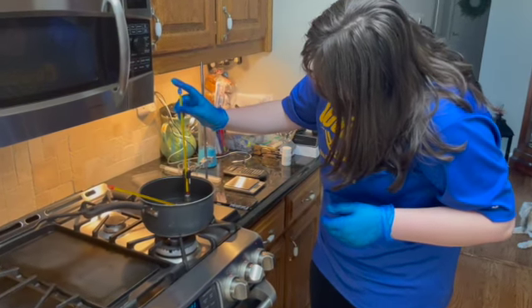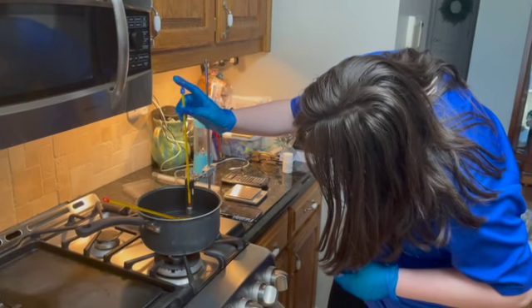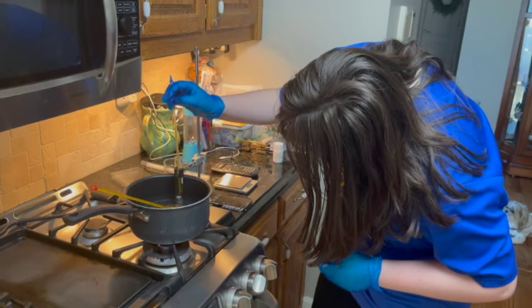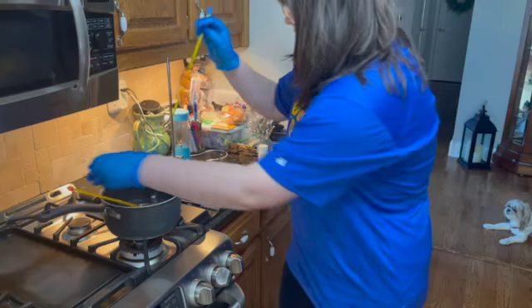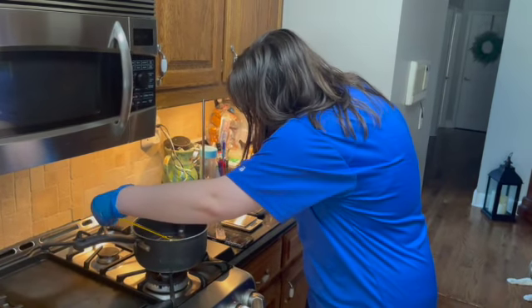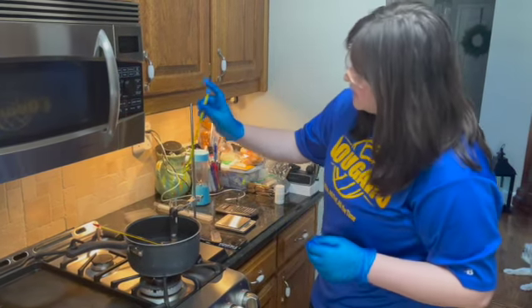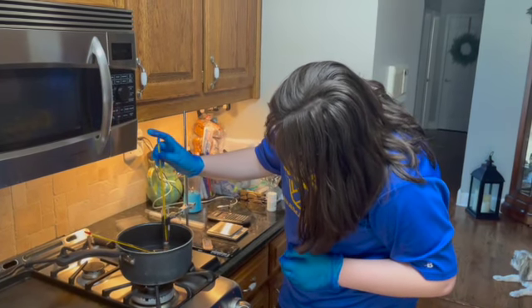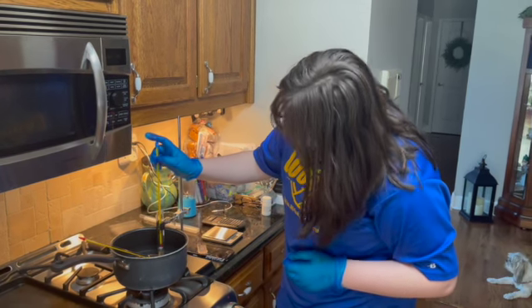We can see, so roughly right now, as we start this off, it's at, let me make sure that I can see it, it's at around 28 degrees Celsius. And let me recheck the hot bath, and that's still at 54 degrees Celsius as well. Okay, suspending it in there. It's actually not getting up to 30, so that's pretty good as well.